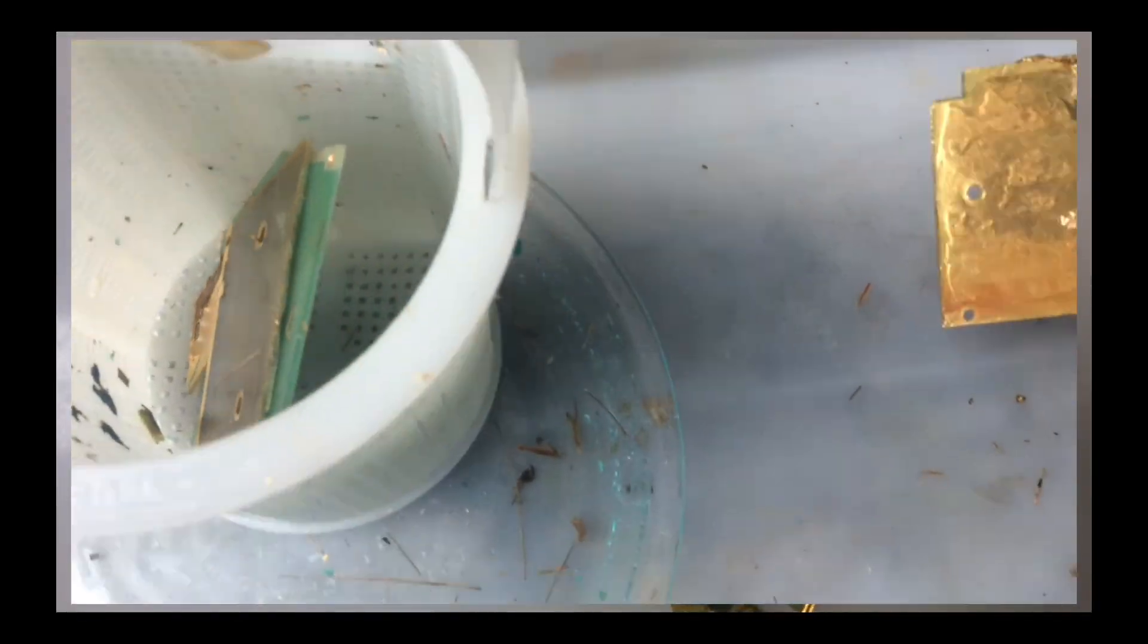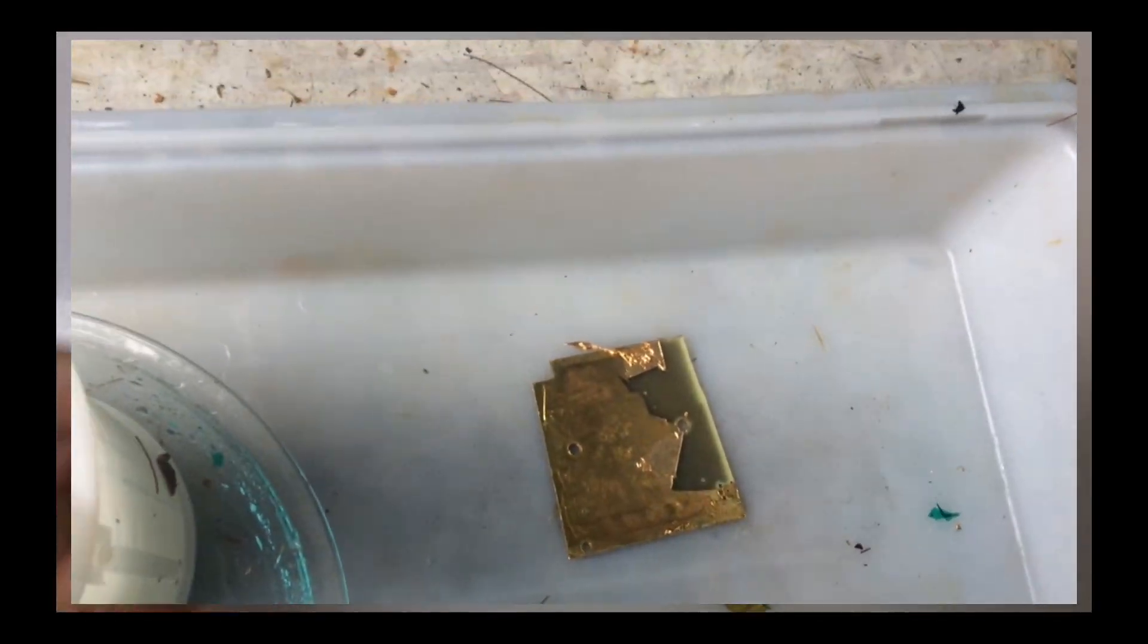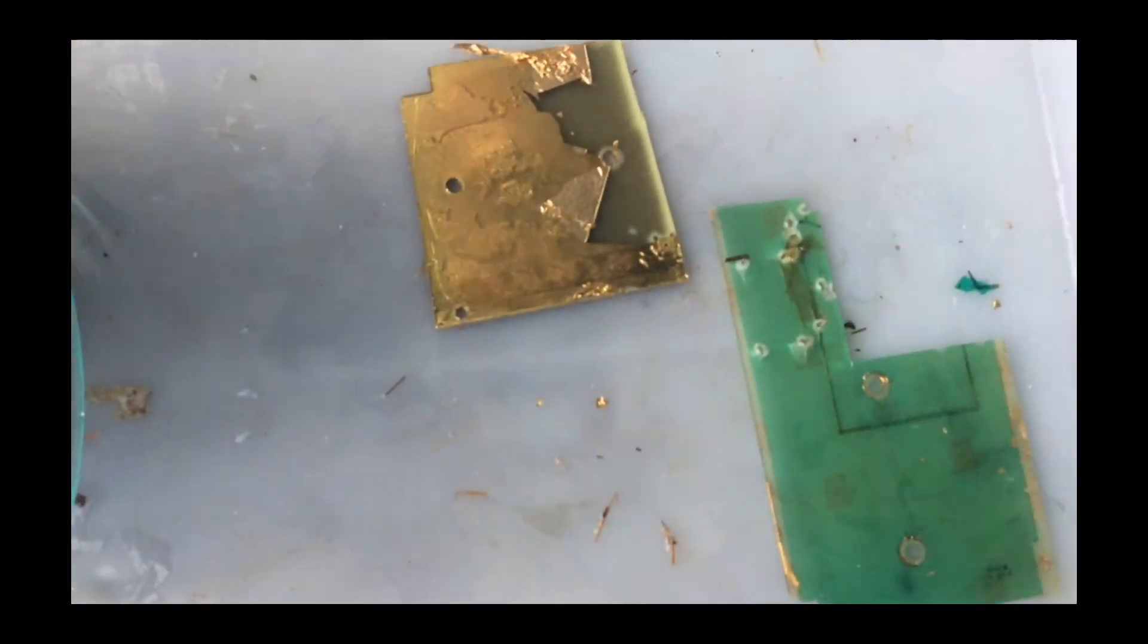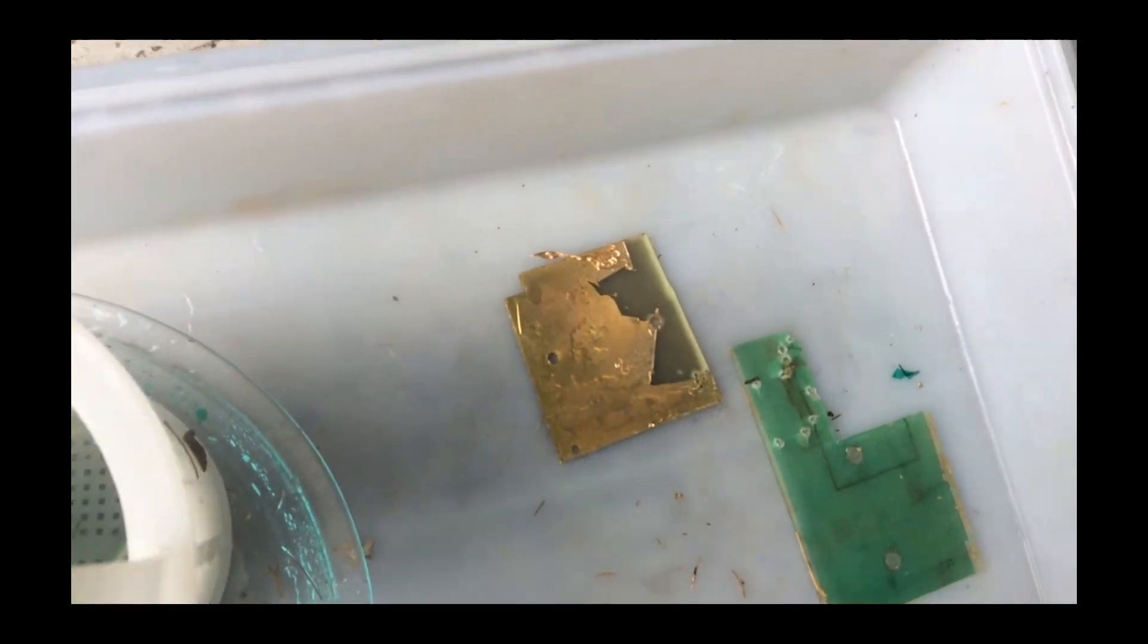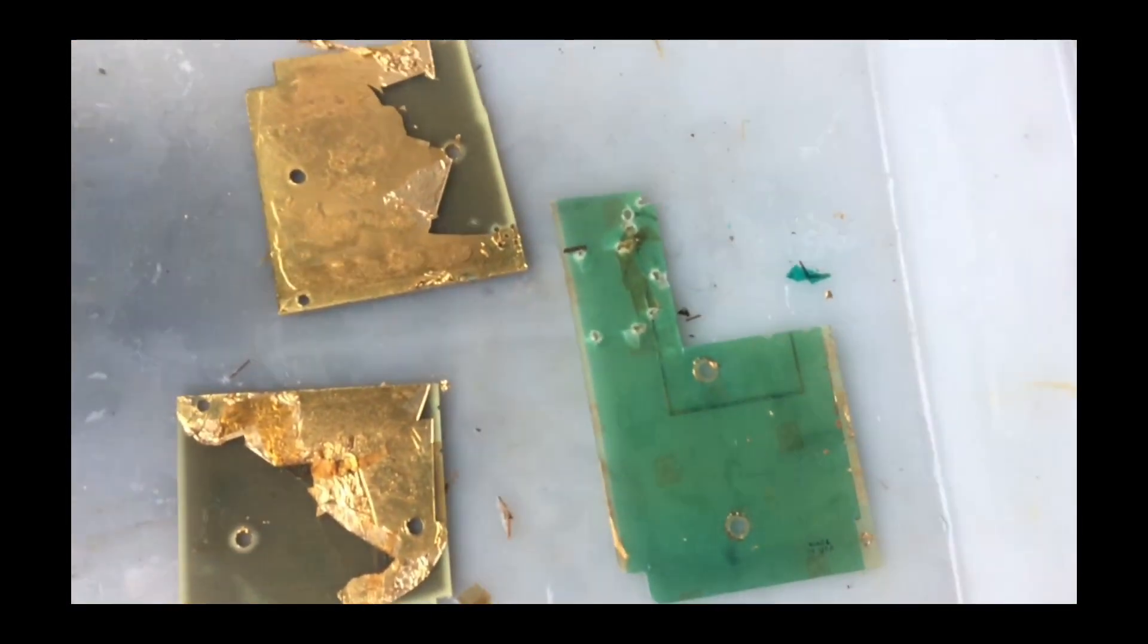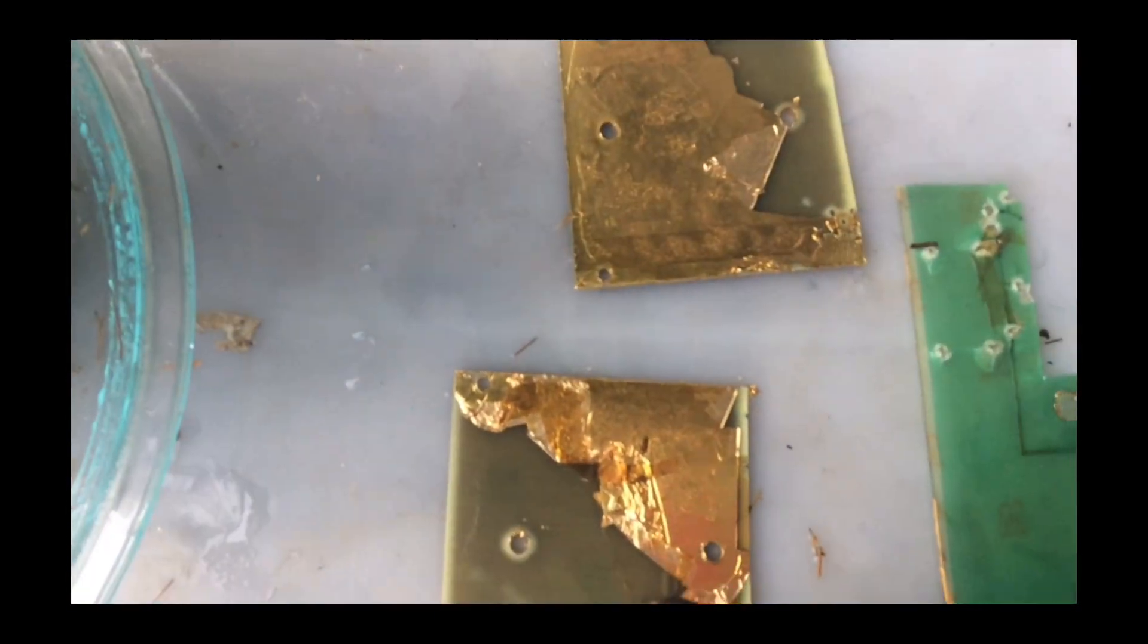Here's the first one. I'll just take out two. Three. This one completely came off. I'll take out these three. And this is truly magnificent.